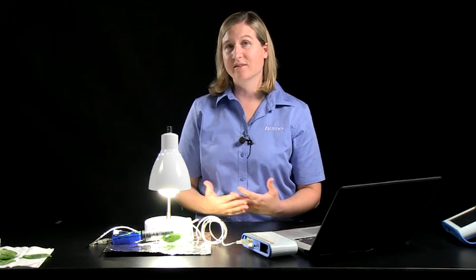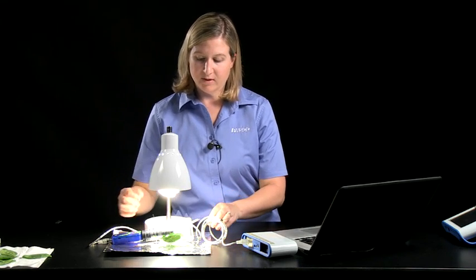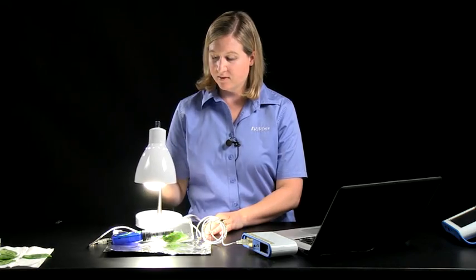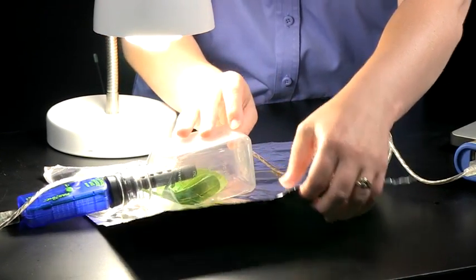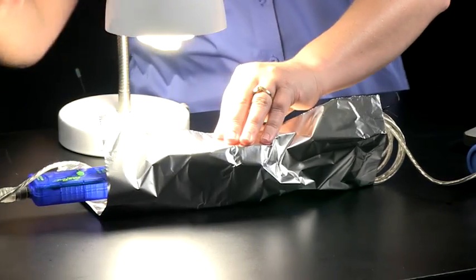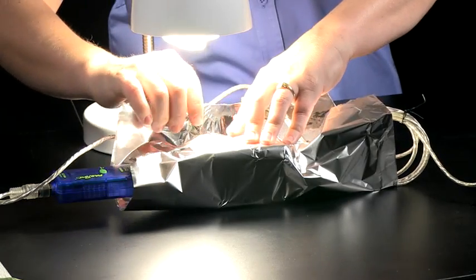So now we're going to compare the change in carbon dioxide concentration due to the photosynthesis and the bright light to what occurs when the plant is in darkness. So the aluminum foil will just fold over the sampling bottle so that the leaves will be in complete darkness.